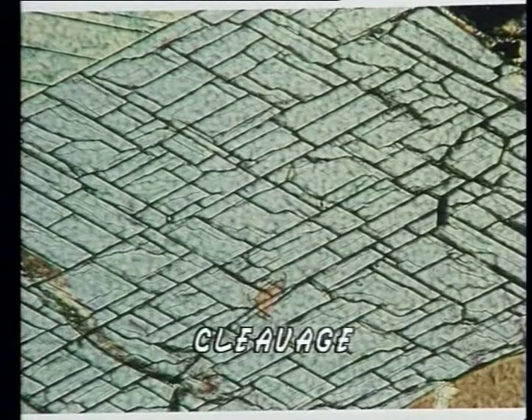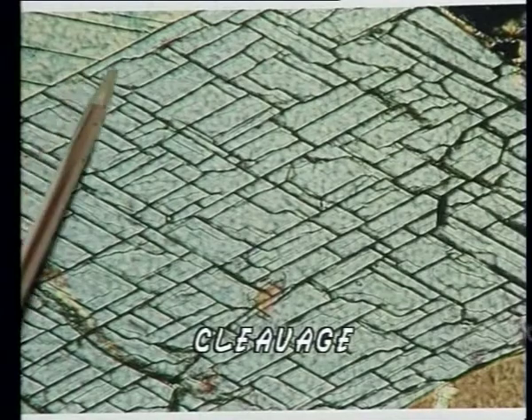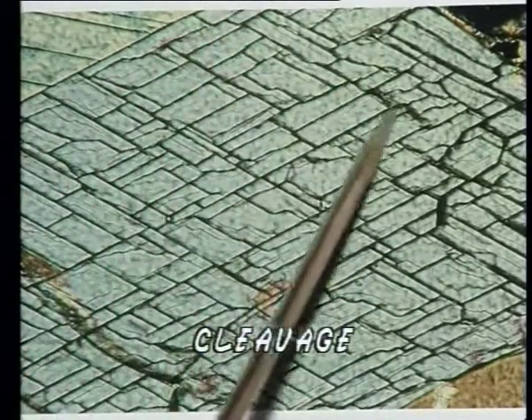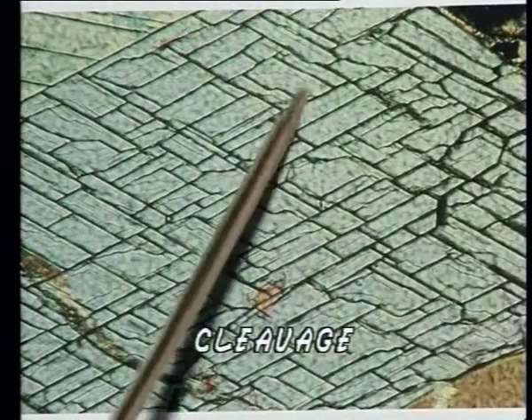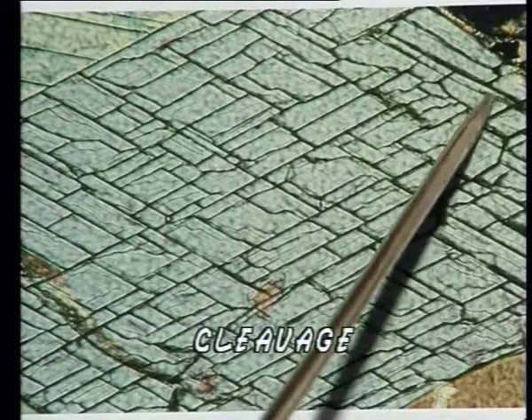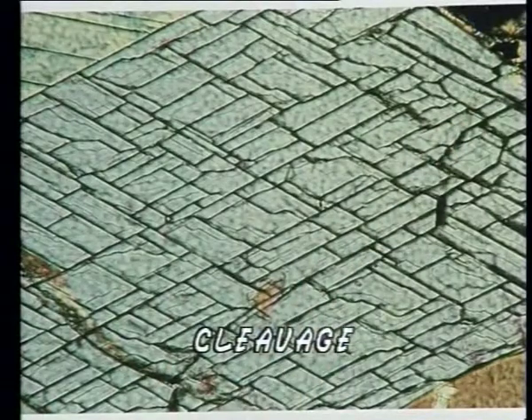In thin section, cleavage of a mineral is seen in the form of parallel set of dark lines confined to a mineral grain. Micas, like biotite and muscovite, are characterized by one set of perfect cleavages. Amphibole group of minerals show two sets of cleavages intersecting at about 120 degrees.